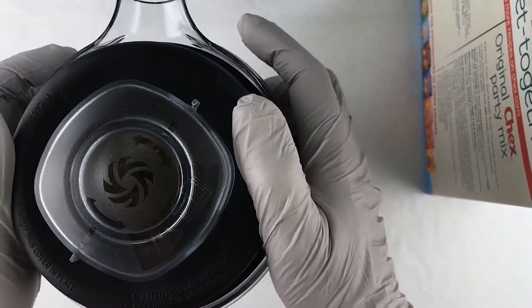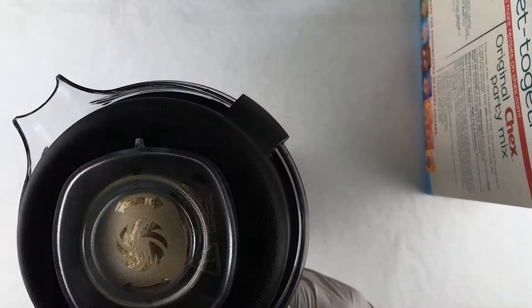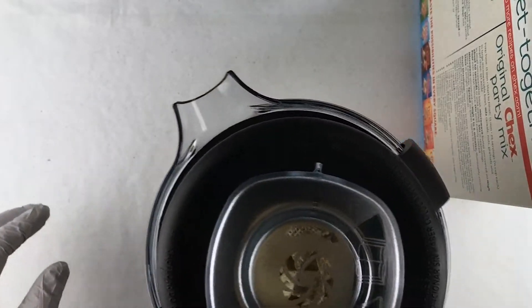All right, I'm going to throw it on the blender which I have on another table here just because if it's on this table I'm afraid the camera is going to go all wonky. So I'm going to throw it on the blender and mix it up.